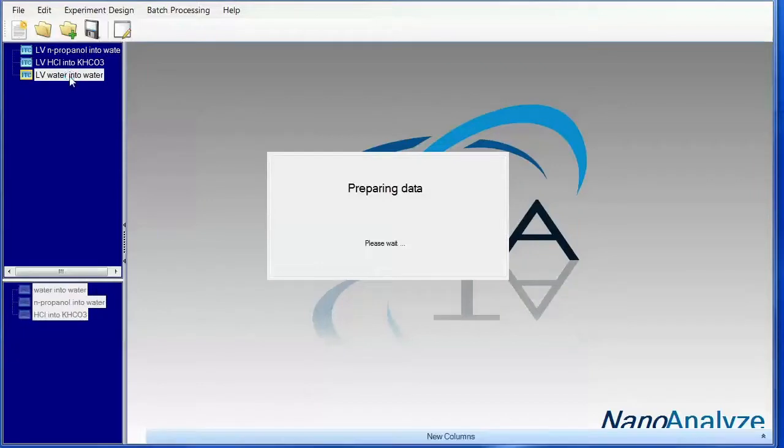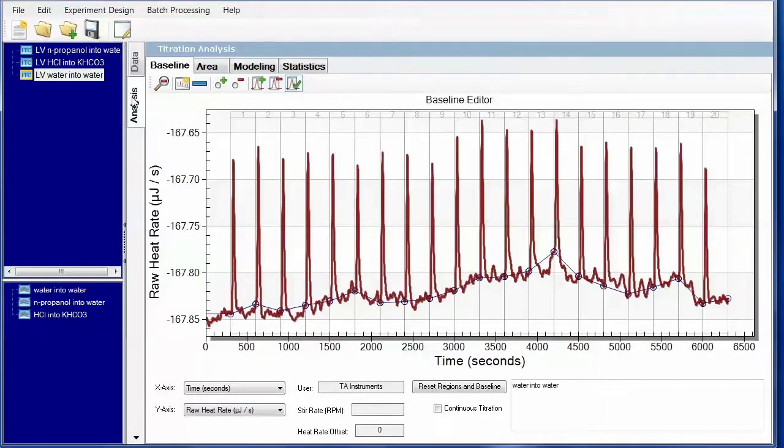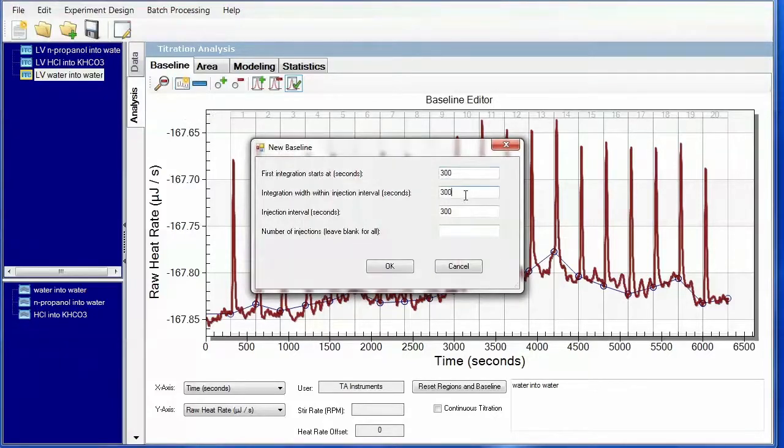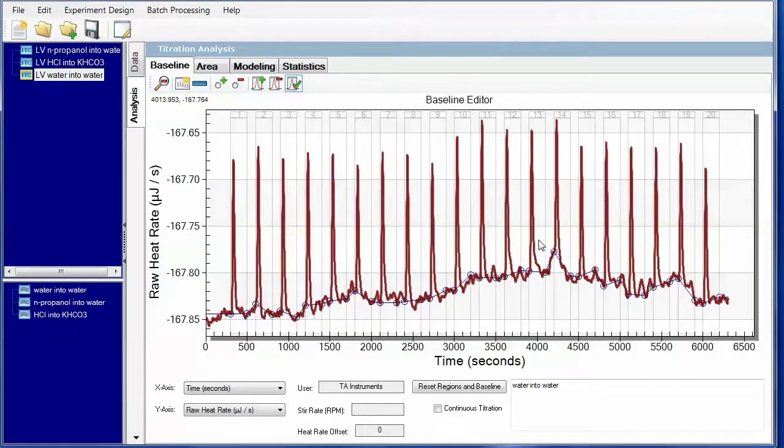So this one we're looking at how does the baseline look? Are we just seeing the minimal amount of heat associated with these injections that is attributed to frictional heat as well as DT between syringe and cell? First step is to recreate the baseline so we don't include unnecessary noise. And now you can see we've cleaned up a few areas.